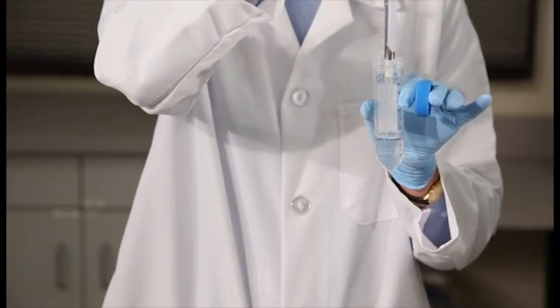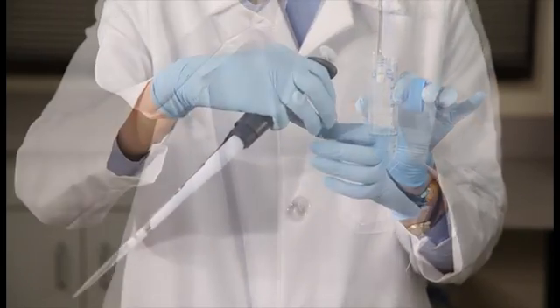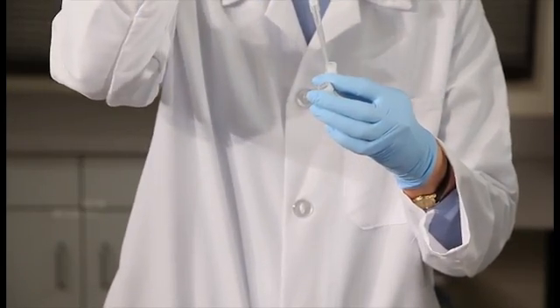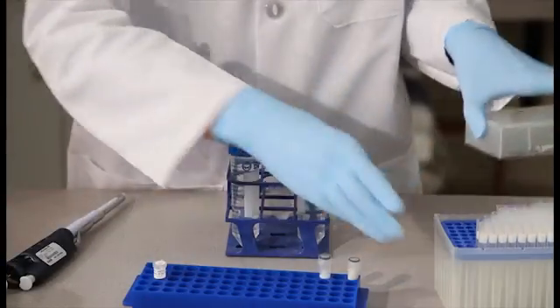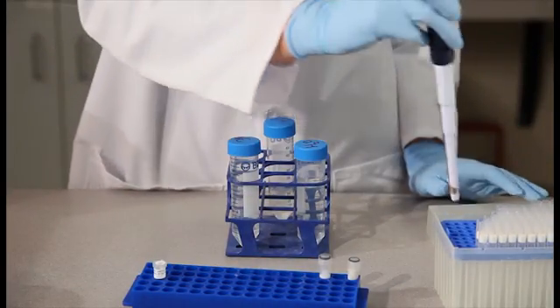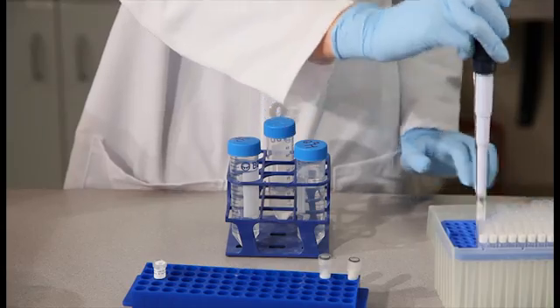Add 500 microliters of the buffer to each screw capped filter tube. Replace the pipette tip each time between tubes to prevent cross-sample contamination.